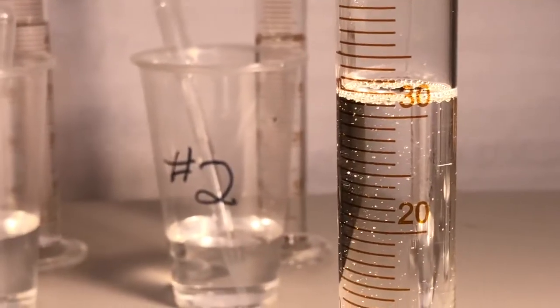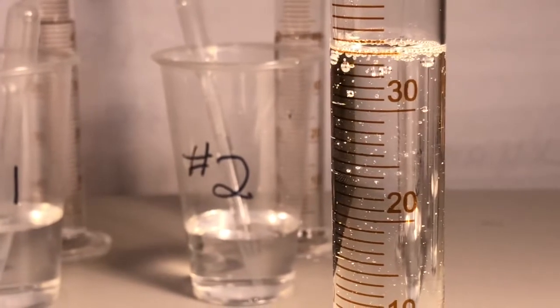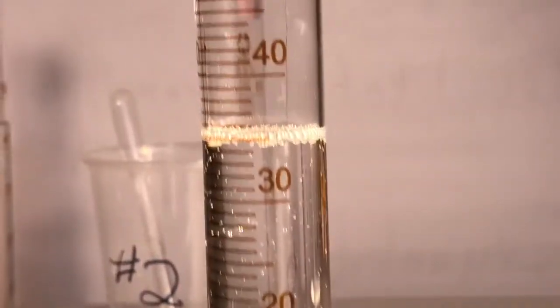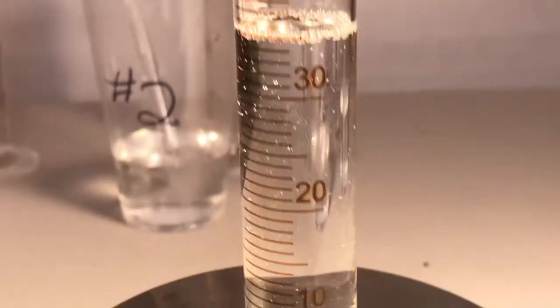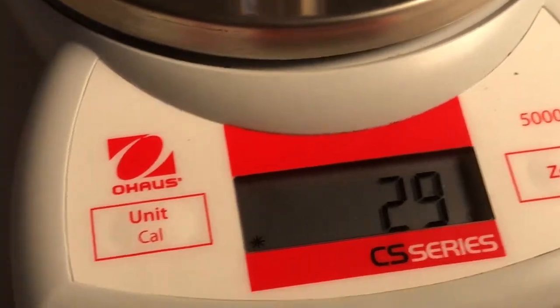All right. Here comes 7. What's that? And 8.